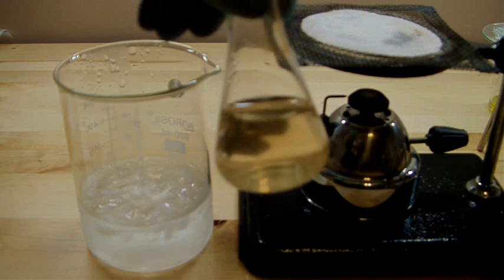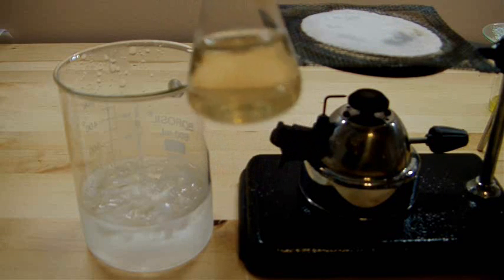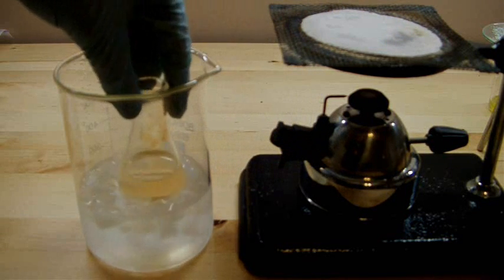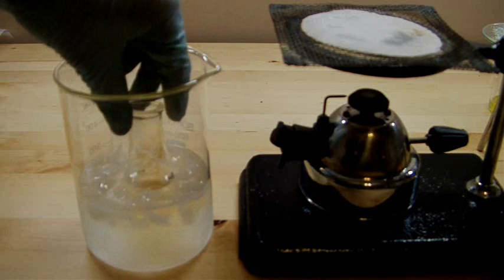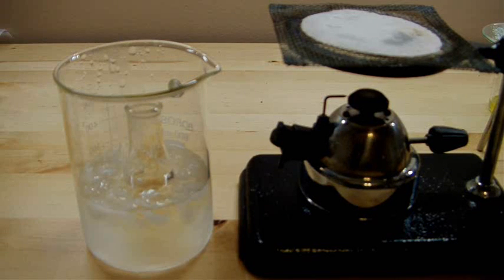I've got the solution about as colorless as it's going to get, I think. So I'm going to immerse it in the ice bath for a bit and let the rest of that come out of solution.